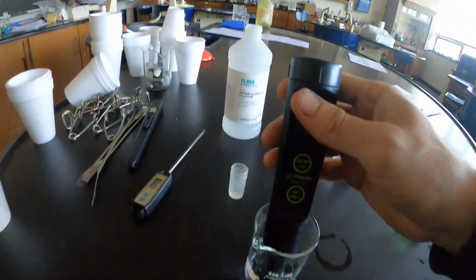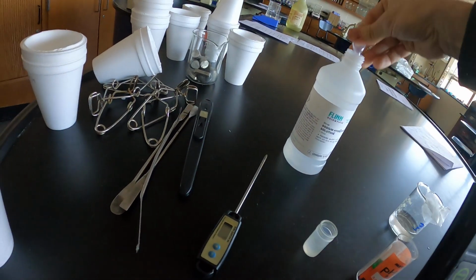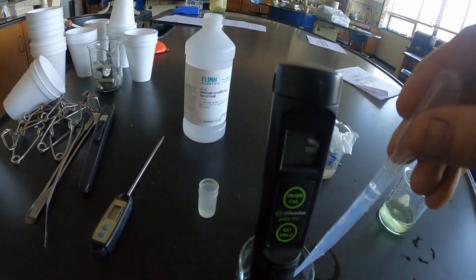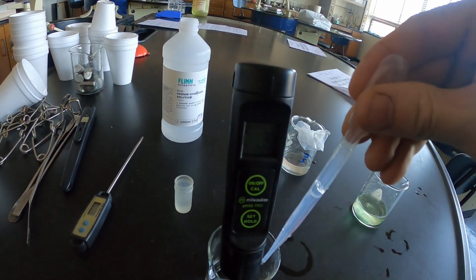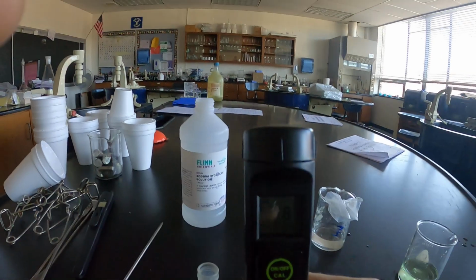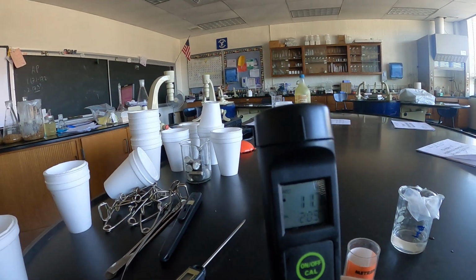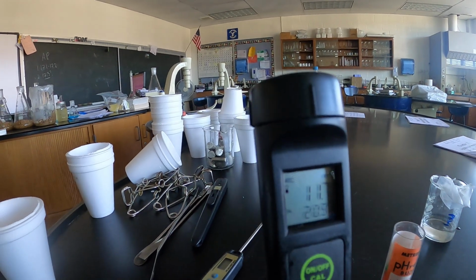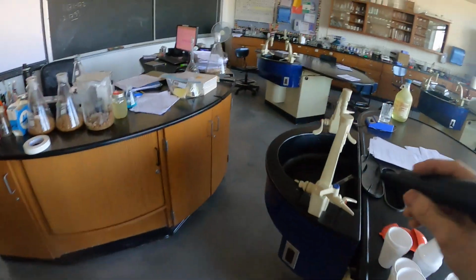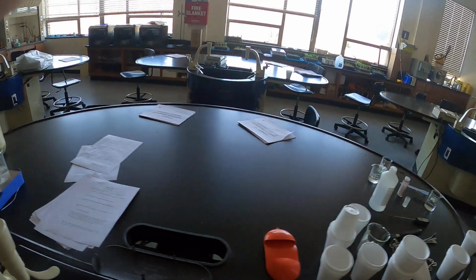So I'm gonna put this pH meter in the water, and I'm gonna add a little bit of sodium hydroxide to it, 1 molar, a few drops. And it is, again, majorly disrupted, skyrocketing, hopefully you can see, to 11.7. Now, alternatively, the buffer can buffer out the addition of this reagent, which I will demonstrate.